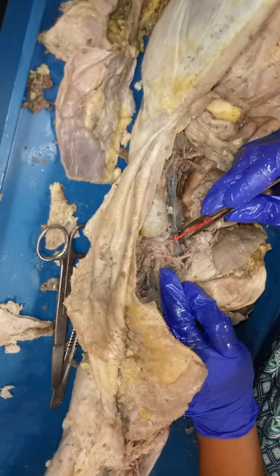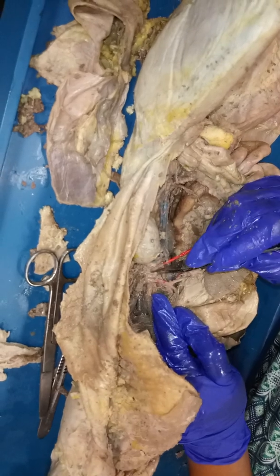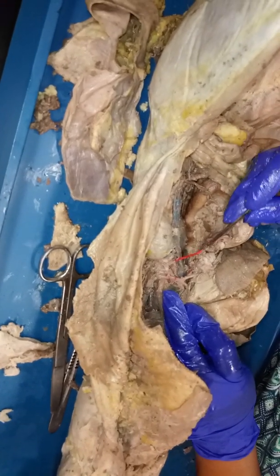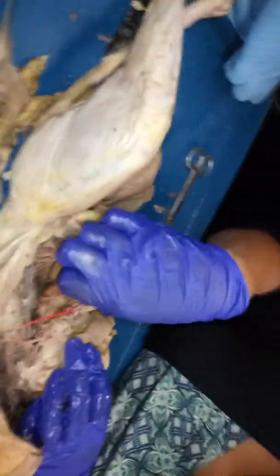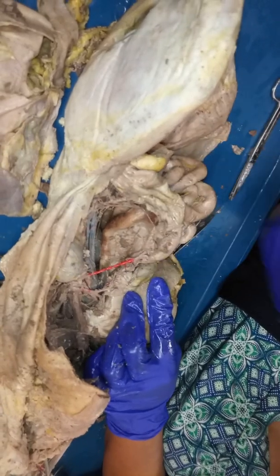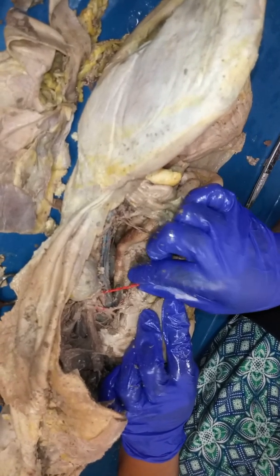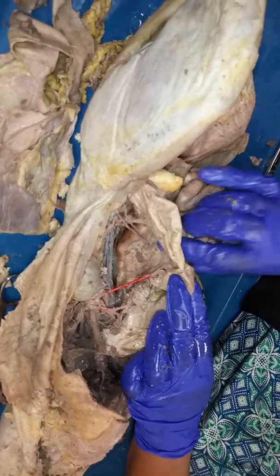Inferior to that, you have this other major branch. It's a little bit broken off, but just to give you an idea in terms of relatively where it is. And this one is what's called the superior mesenteric artery. How you can tell it's a superior mesenteric artery, it has to go to the majority of the intestines, which it does. So if you see a fairly large vessel that's going to the top part of the intestines, it's going to supply the majority of the digestive system. That should be your superior mesenteric artery, and these are your intestines right here. So just to give you an idea.